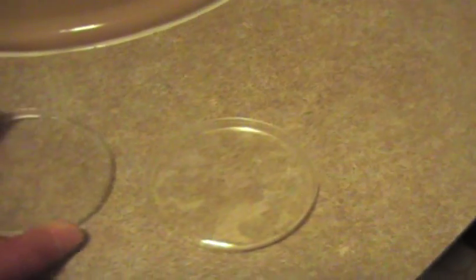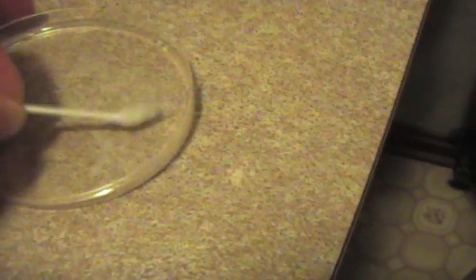Alright, we're here in the bathroom now, and we're going to open up the petri dish. Hold out your hand. We're going to get the cracks here and then we're just going to rub it on the surface. And then we're going to close it and set it aside. Then Sammy's going to wash his hands.